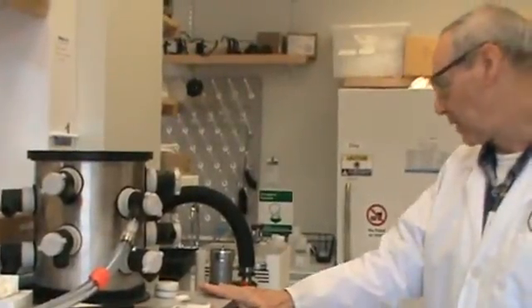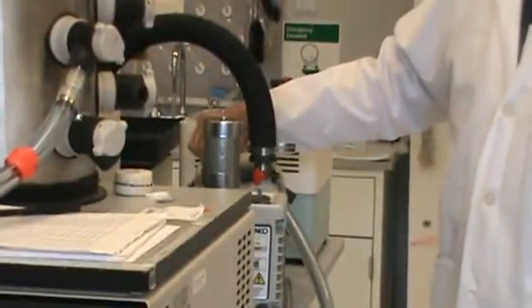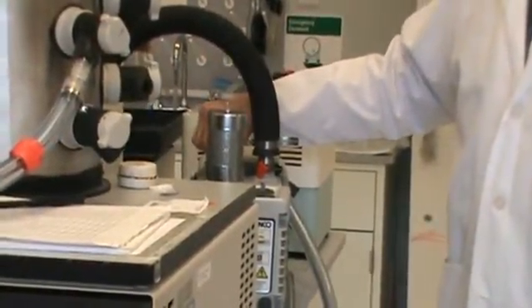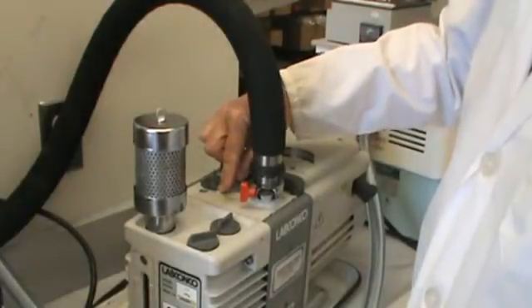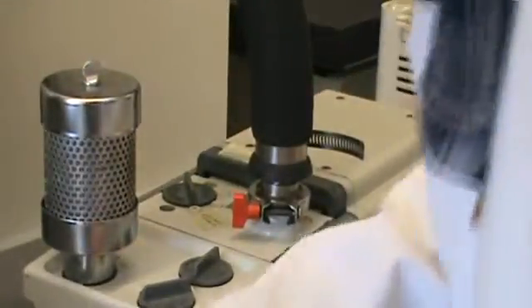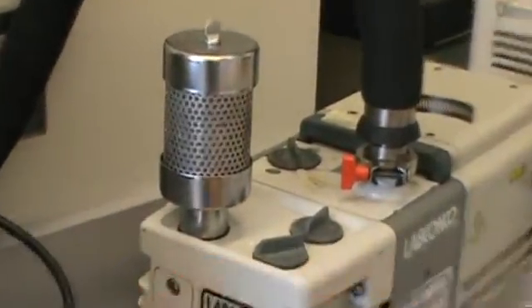We would turn the pump on when the refrigeration is down. This is for a fine point. This has an extra thing. This is the way we always leave it. First you always check for pump oil to make sure your oil is okay, same as anything else, set to about three quarters or two thirds.